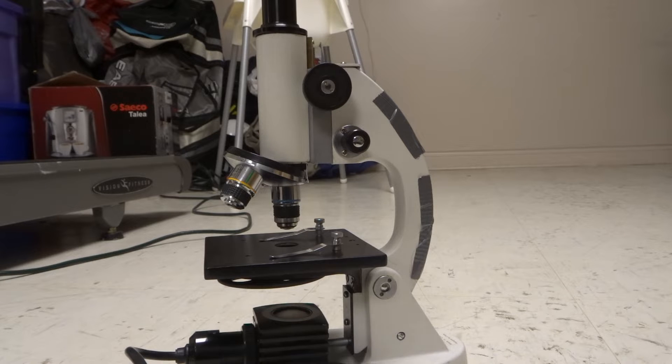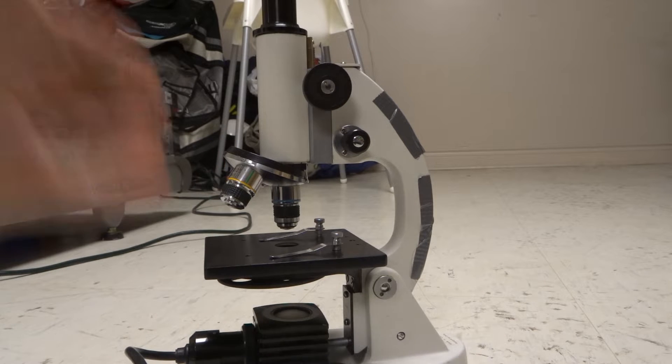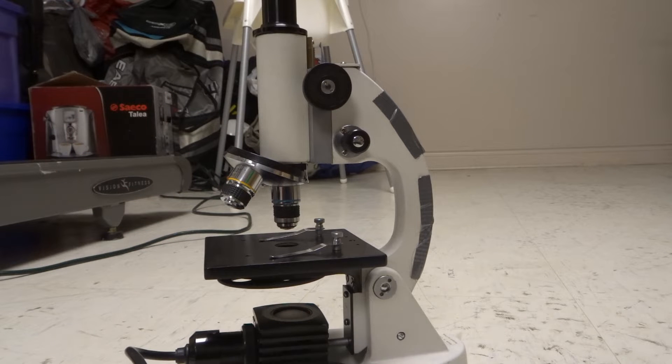So as you can see right here, we have a very simplistic microscope. This is an old school, older style microscope, but the newer ones will work in pretty much the same manner. They just might look slightly different.